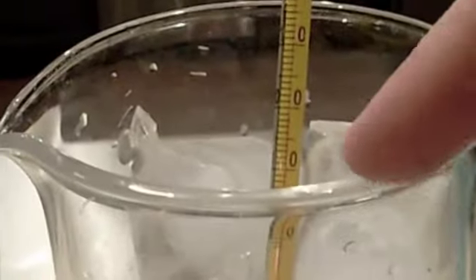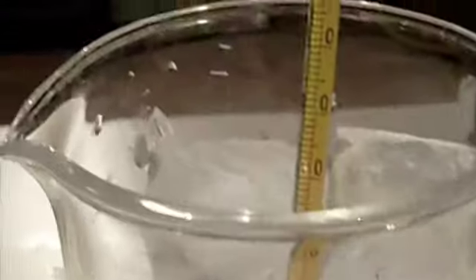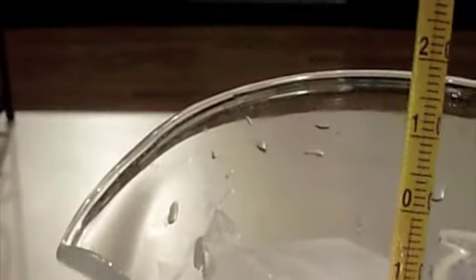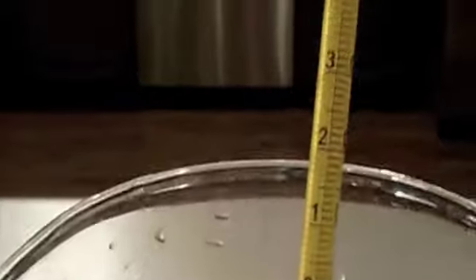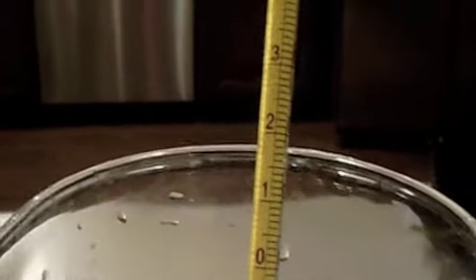First thing, last thing we might use is our oven mitt, okay, because it will protect our hands from the heat.